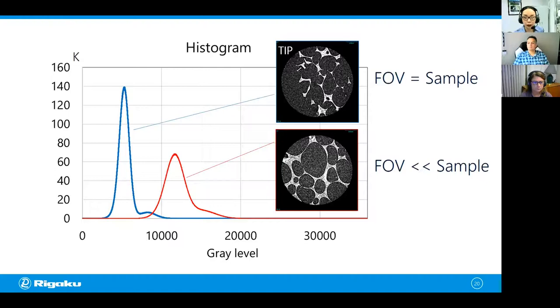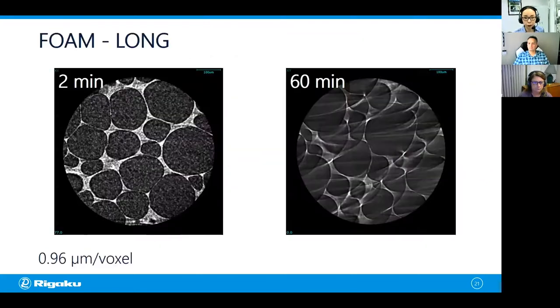Now, let's take a look at the long sample a little bit more. If you do a 2-minute scan on that long kind of wobbly sample, it doesn't look too bad because it's not going to move that much in 2 minutes. But if you use the same sample and run the scan for 60 minutes, this is what you're going to get. Now you can kind of see that everything is swinging, right? And everything is blurred. So now the question is, how can you tell that the sample was moving? And how can I tell that this is not the way the sample is, but this is just the sample moving around? So that's going to be the next question for you, the audience.